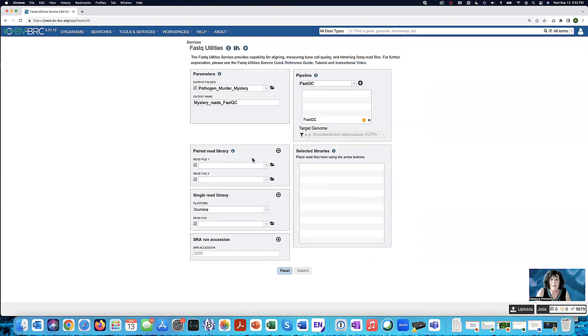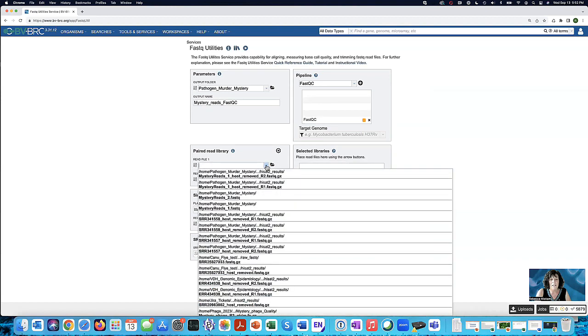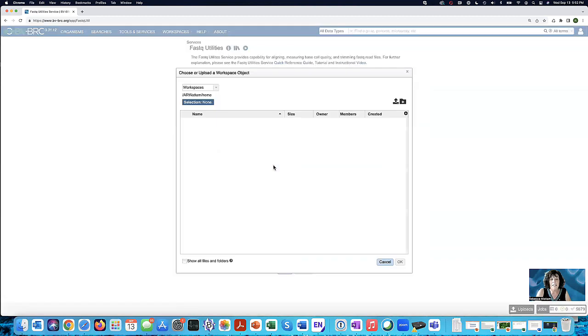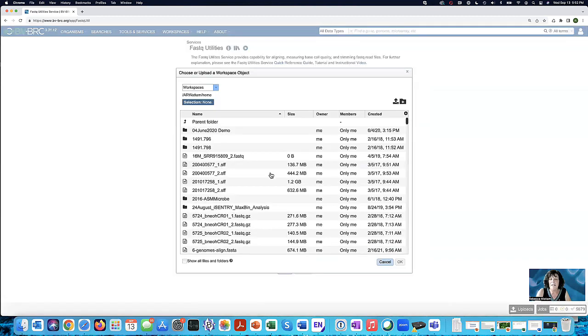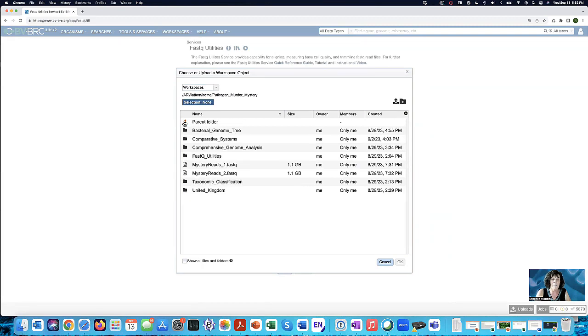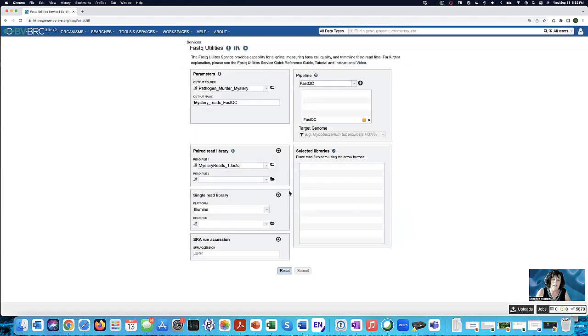So, read files. I already have files here to analyze. If I knew what they were, I could click on the down arrow and see ones I've uploaded recently, or I could navigate in my workspace by clicking on that folder icon. And then I have to navigate down to my folder. And there I've got the mystery read. So I click on the row and that highlights it. And then I can click OK. And look, the name appears here.